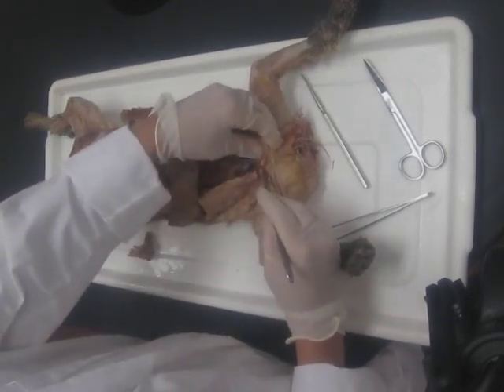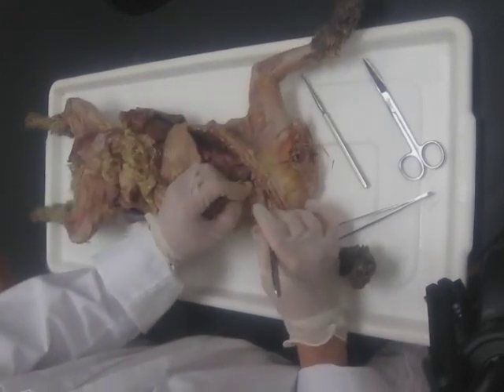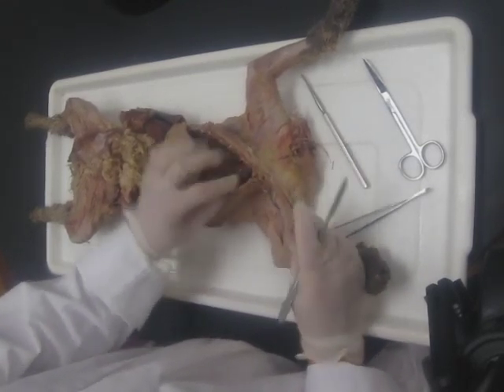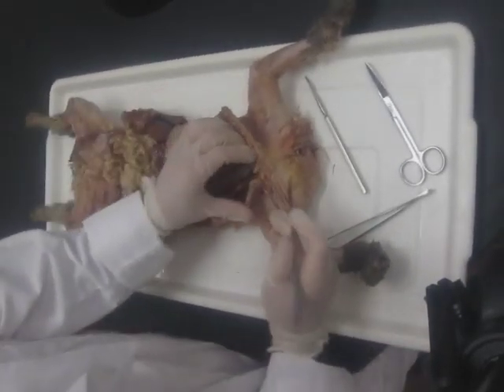This first rib is giving me a little bit of trouble. Light incision, move the tissue away — light incision, move the tissue away. You can see that you've got that nice blue vessel there.